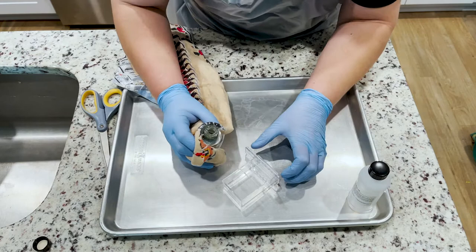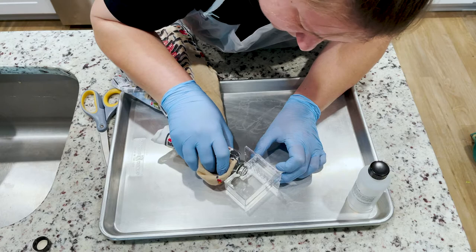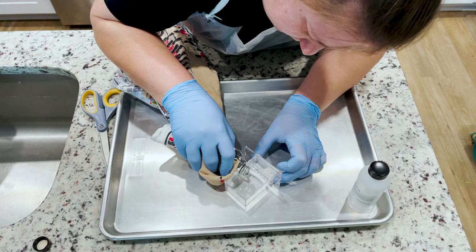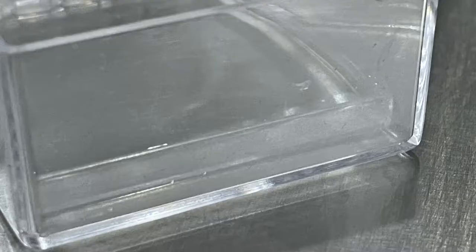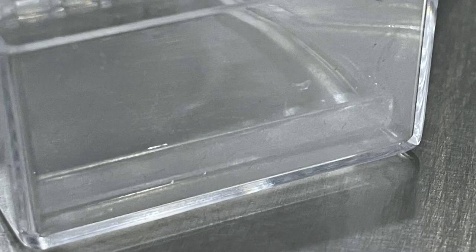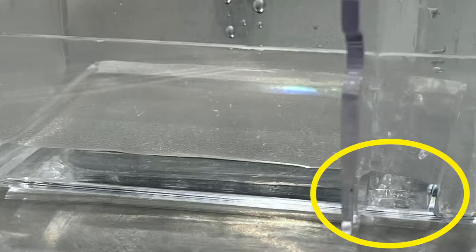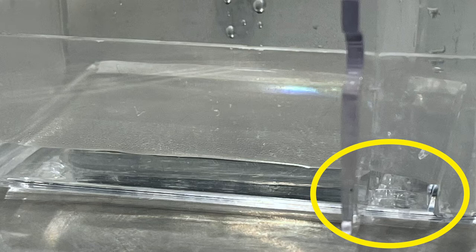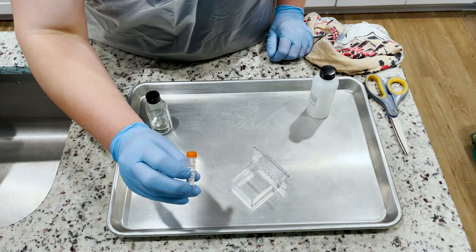When pouring the agarose into the gel box, I recommend that you touch the neck of the bottle to the side of the gel box. I tried to just pour it in there and actually spilled it, so if you touch it to the edge it'll work a little bit better. Here's a shot showing that the gel is in between those ridges and it's filling up that area between the ridges but it's not going to the areas outside the ridges.